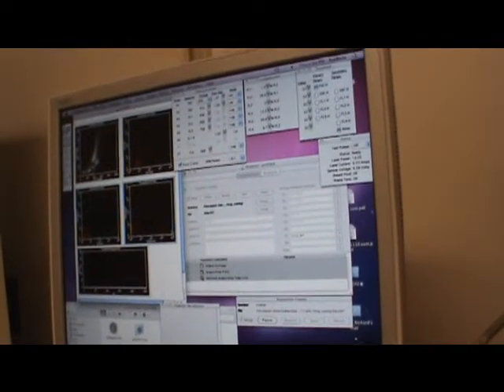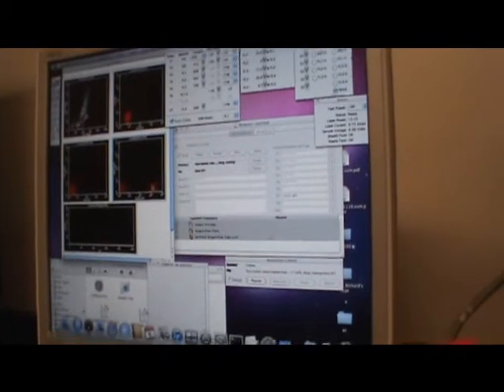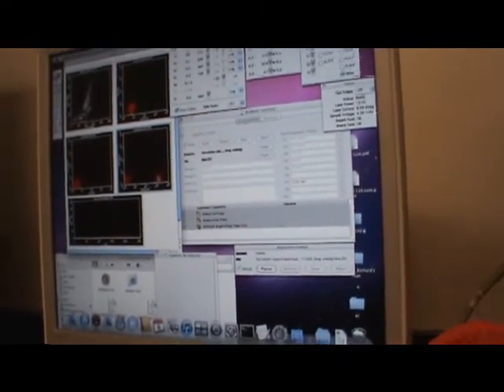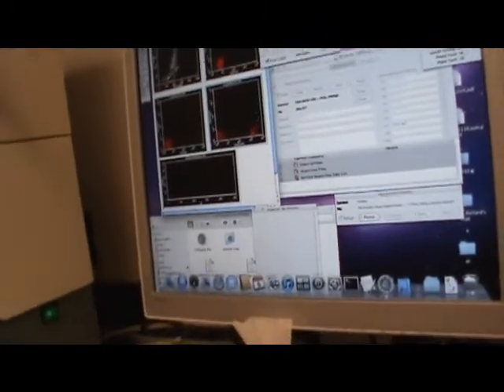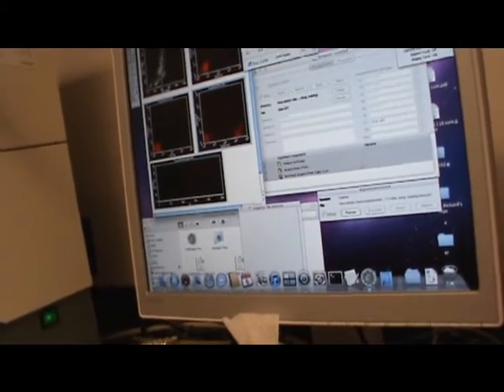So one good thing is, because there is no spillover between these, this one seems to be red color, and it's pretty stable. So you don't have to worry. The only problem we saw was between these two, FITC and PE. These two are pretty good, nothing is changing.